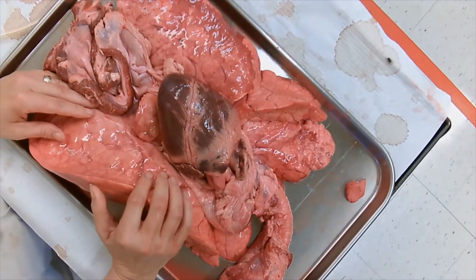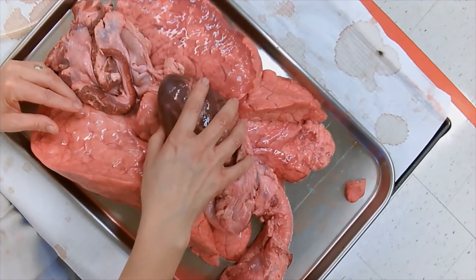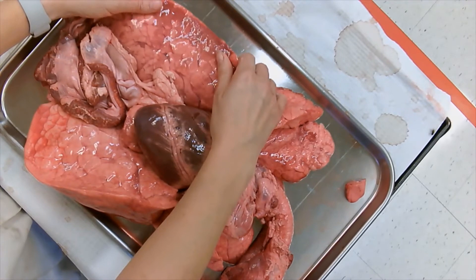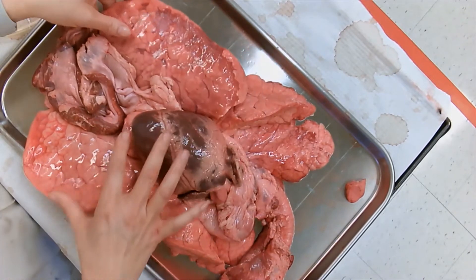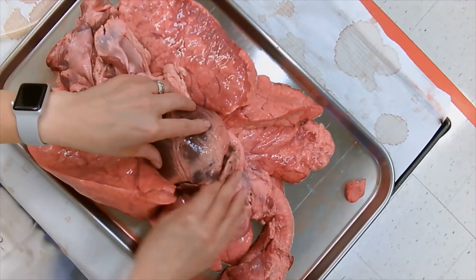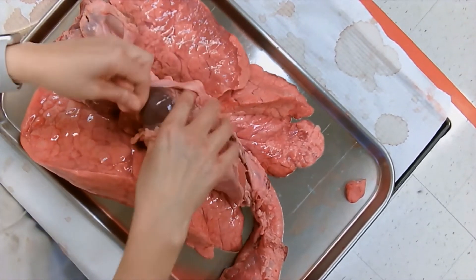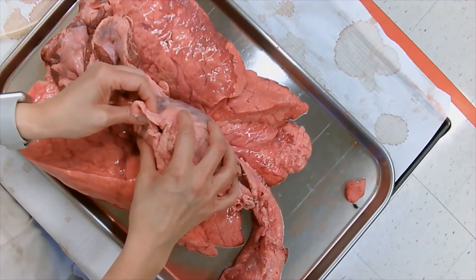This is the heart right here, and you can see all the nice lungs. The lungs are very very delicate, very soft, very light, and very fragile. When you come up to touch them, be very careful. We even have this covering for the heart — a little bag made specifically just for the heart, the pericardium.